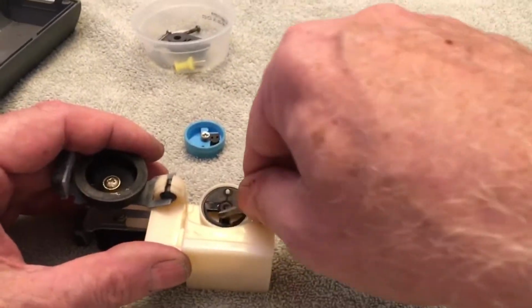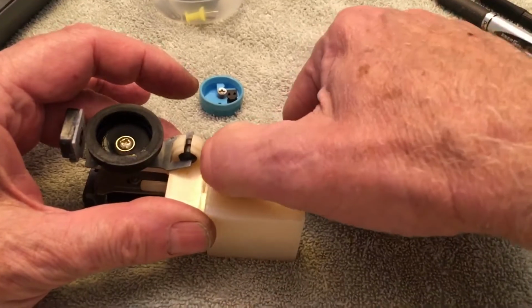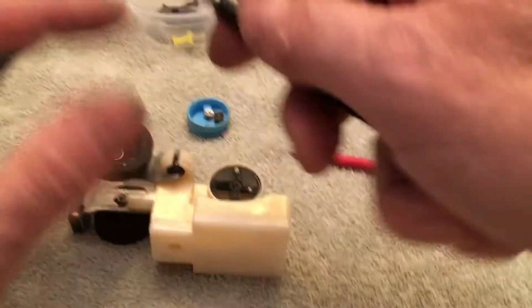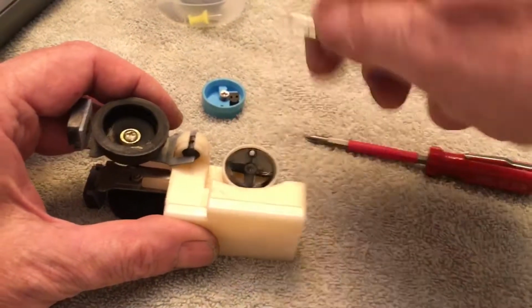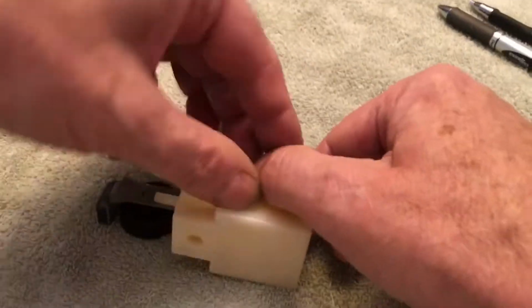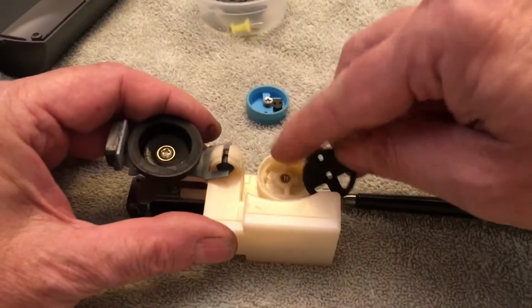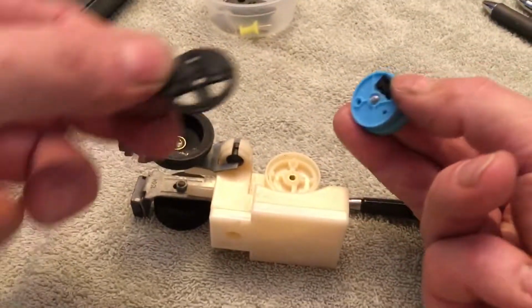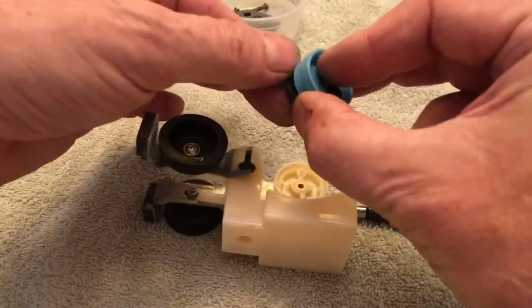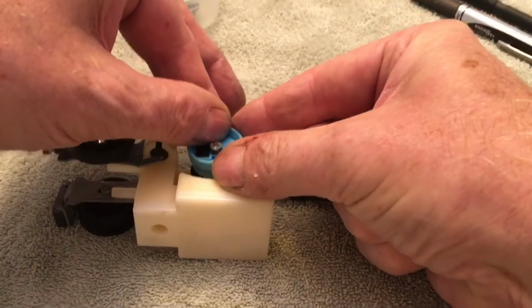This one seems to be a little bit stuck, so we're going to clean this out. This is just a mechanical pencil, by the way, with the lead retracted, so I can get underneath here and loosen up this gasket. So you'll notice there's a pin, there's a keyhole here. And there's a keyhole in this piece too that lines up to keep it all in place. But what we want to do is rotate this unit 180 degrees and put it together.